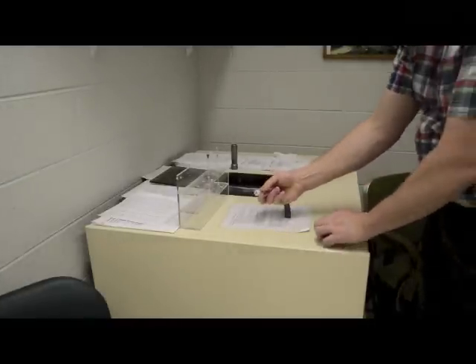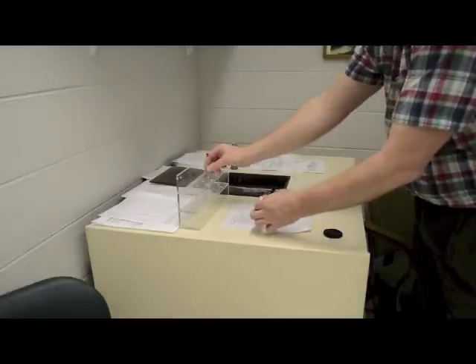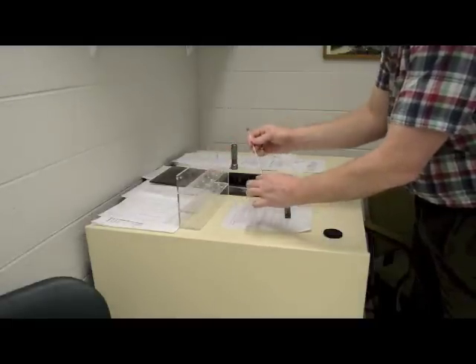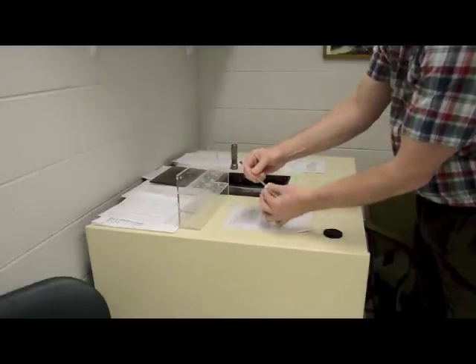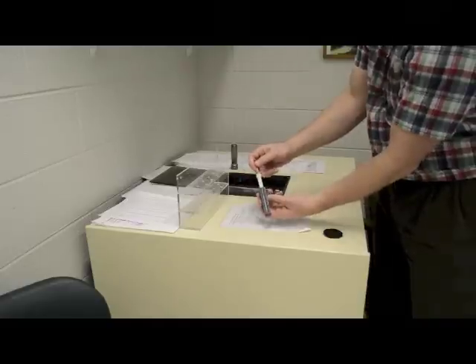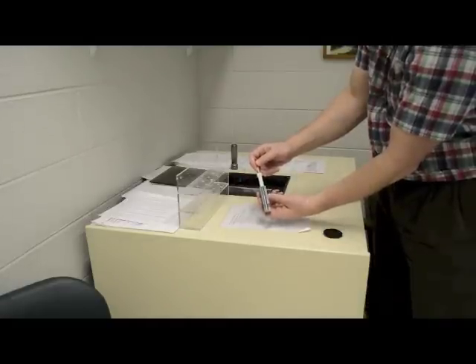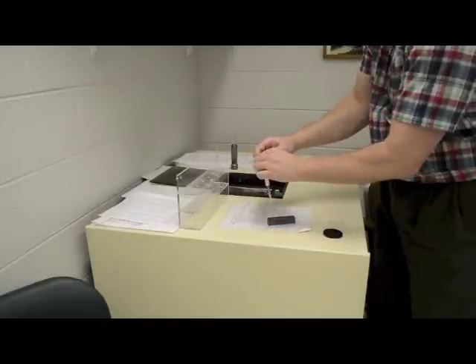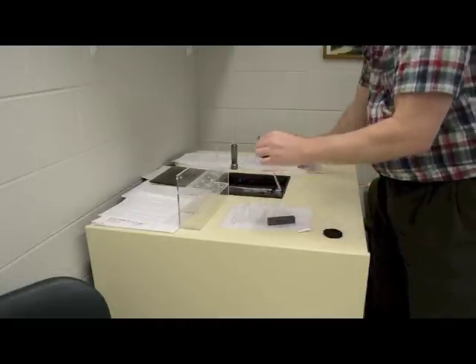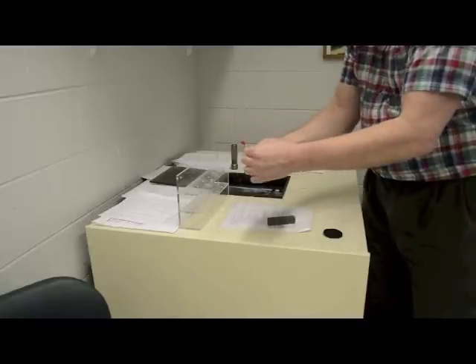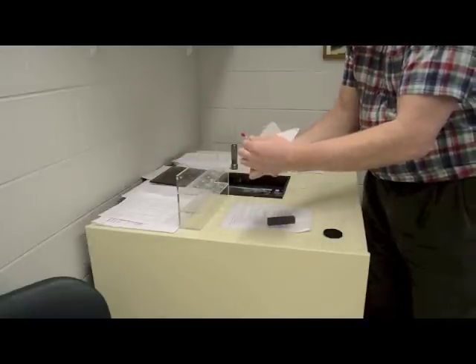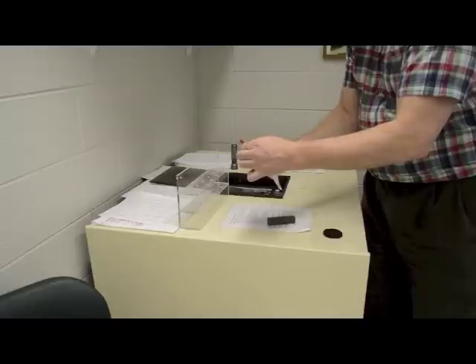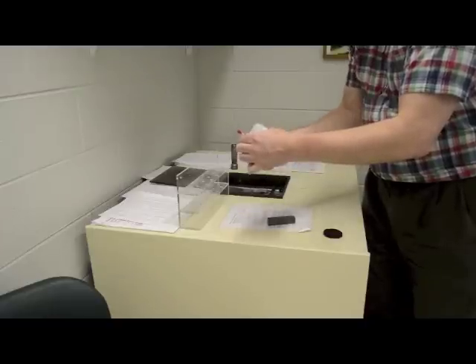Insert your NMR tube into the white Teflon spinner. Use the gray template to ensure correct positioning of the tube in the spinner. Once it's positioned, wipe the NMR tube and the spinner off with a chem wipe, and then insert your sample into the instrument.